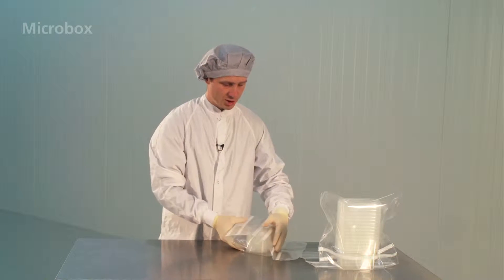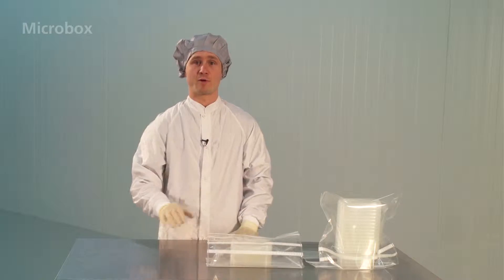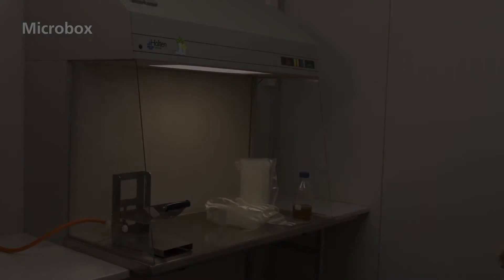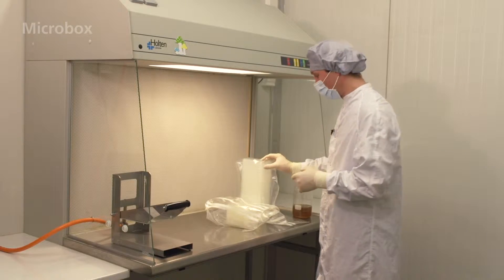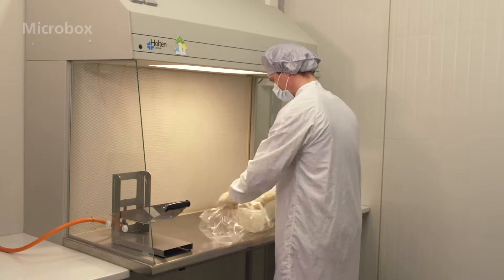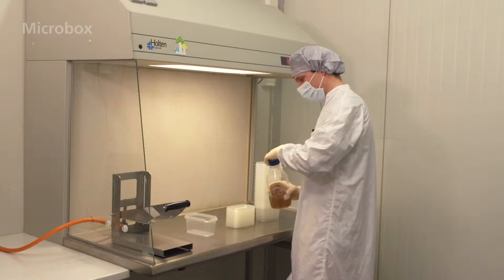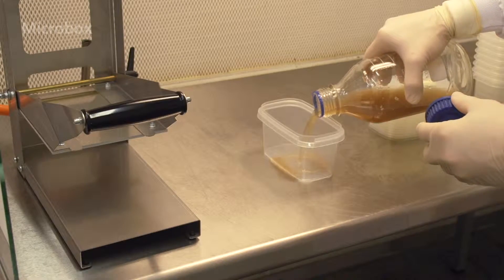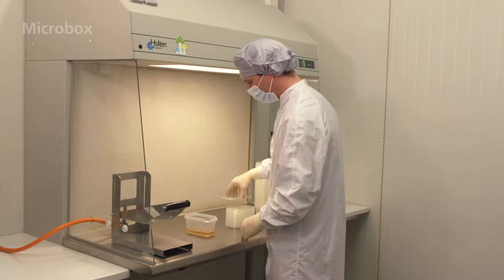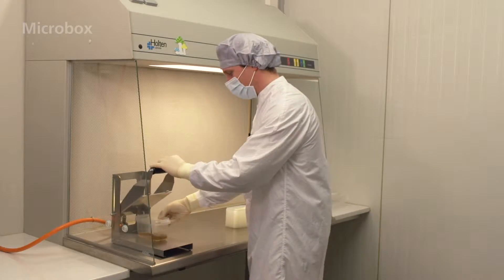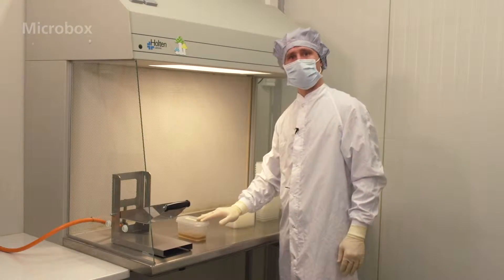Then, when you're finished, simply put these bags in the autoclave for about 20 minutes. Unwrap the bags in the laminar airflow and fill the containers with the medium. Once closed, the containers are ready for storage in the cleanroom area.